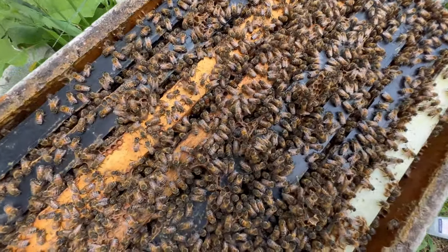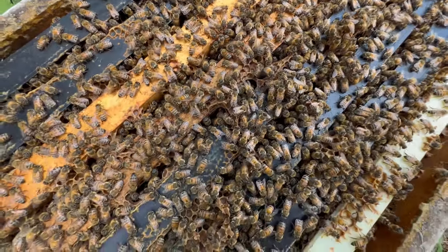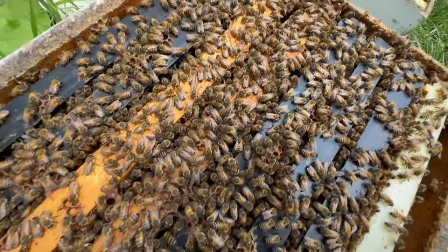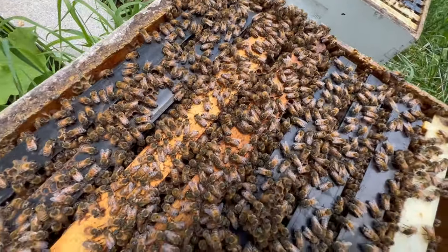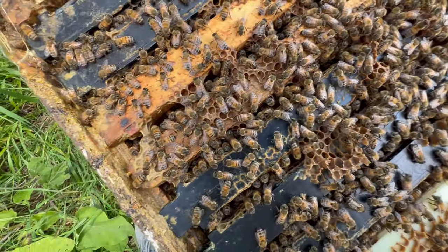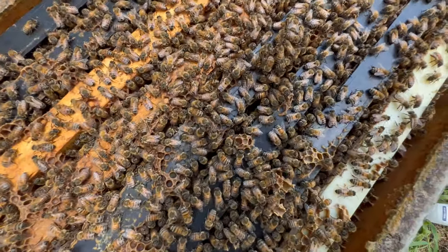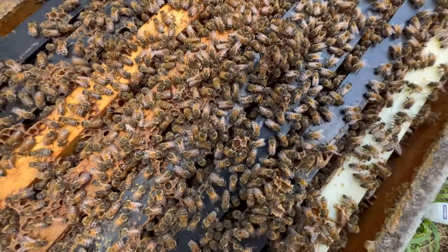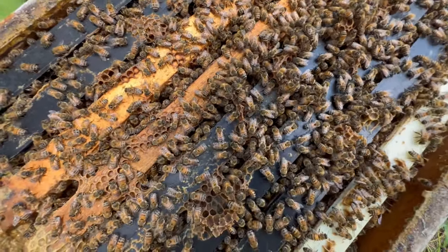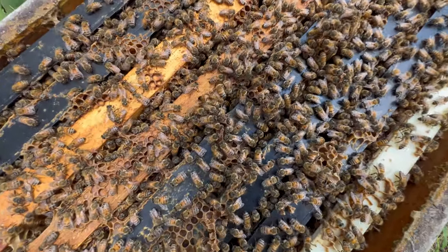It is an absolute joy to see the growth of this colony of bees. In earlier videos I'm sure you heard the worry in my tone of voice as I looked at these, but it is marvelous to see these growing. These look like just happy, hard-working, wonderful bees. So let's open up one of these frames and we will do a mite test.